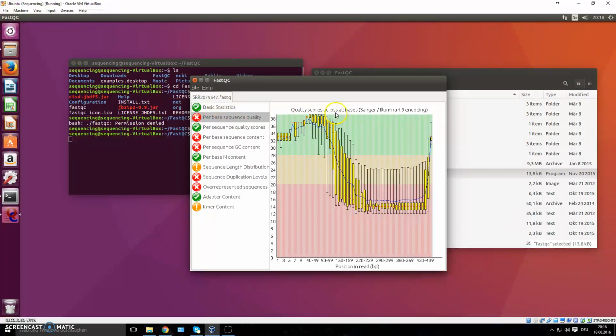The quality scores of your bases. Down here, you will have the position in read. You will have the base pairs. So there you go.